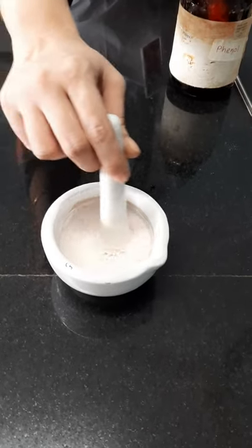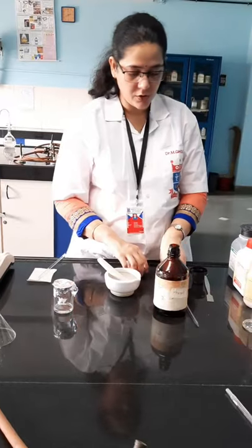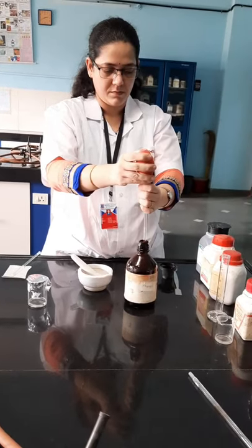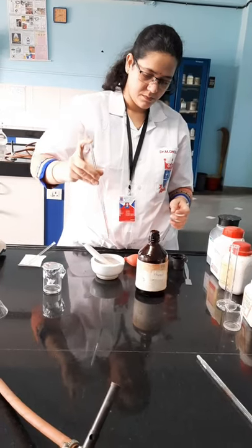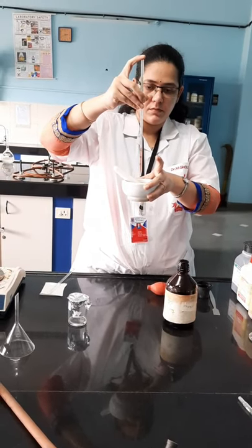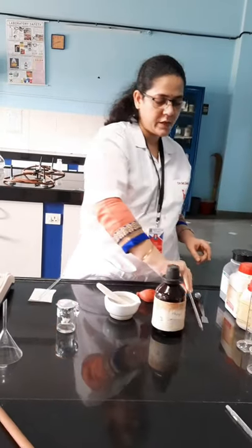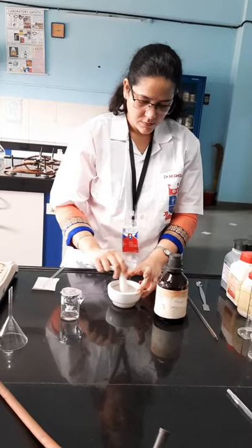This suspension is now ready. We have to add liquid phenol and glycerin to this. The amount of liquid phenol is 0.1 ml. Never touch the tip of the pipette to your preparation, otherwise it will contaminate the entire bottle.